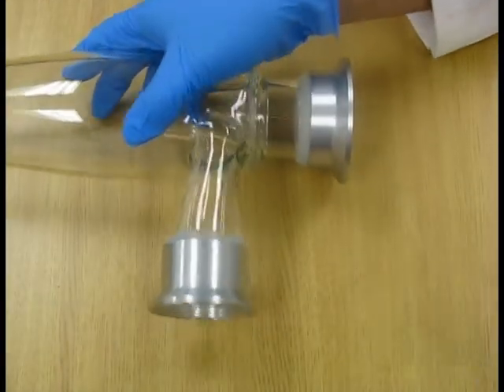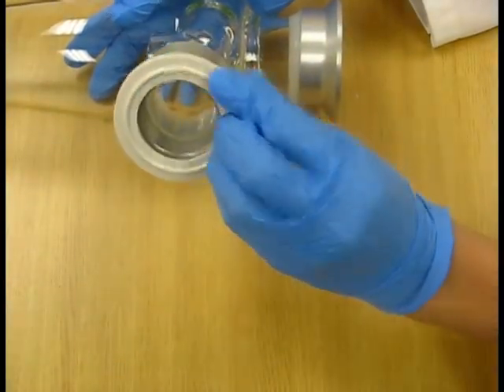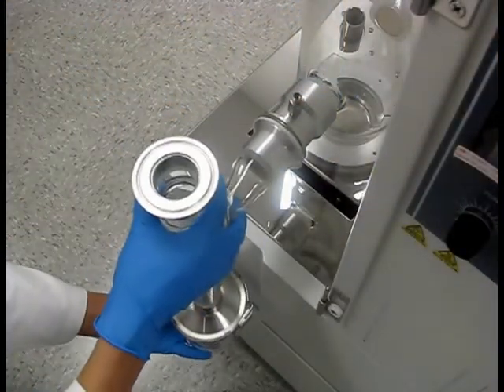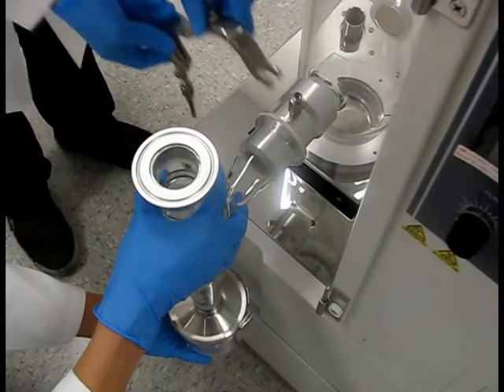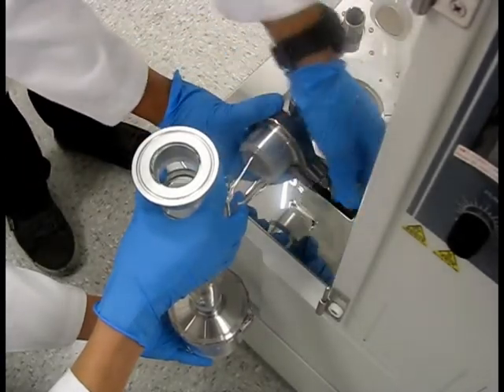The cyclone is a very delicate piece of glassware and should be handled with extreme care. Install the appropriate gasket, then align and connect the cyclone to the opening on the drying chamber. After connecting the two parts, fasten them together with power clamp 40A.